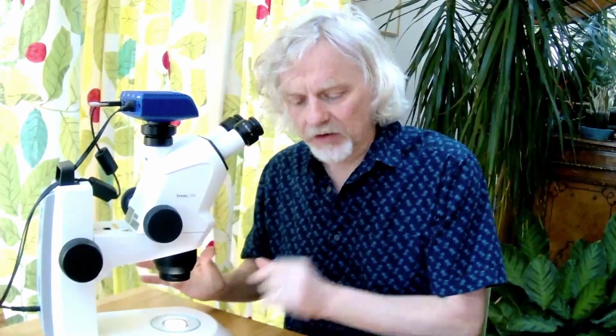And you might be thinking, well, that's completely useless. Why would you want to do that? Well, that's where crystals come into play. So, okay, here's my microscope. Let me explain to you the setup on the microscope.